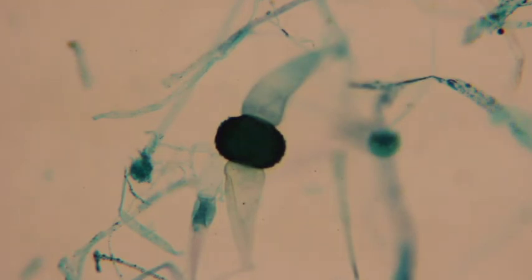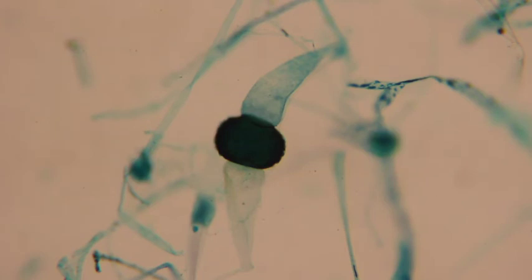So the sexual stage here is where your plus hypha and minus hypha come together. Then they create that ball. That ball then is a zygosporangium. The ball itself is dikaryotic. The hyphae coming in are haploid.